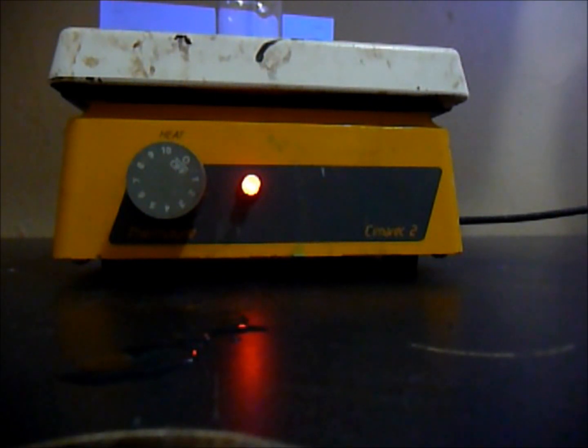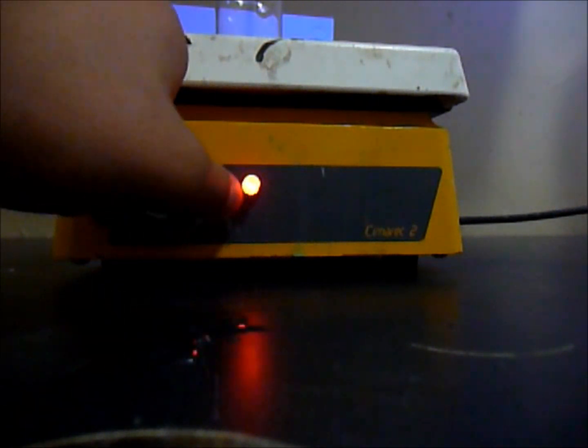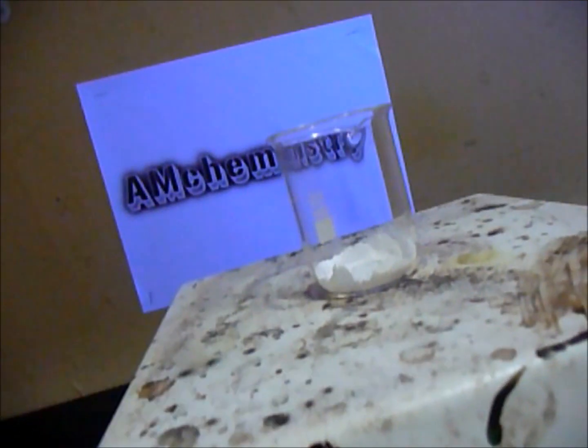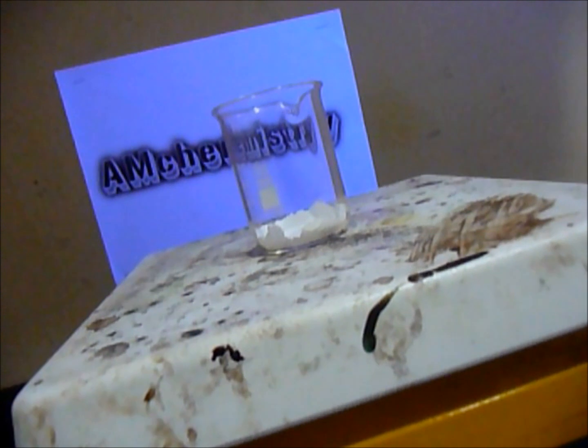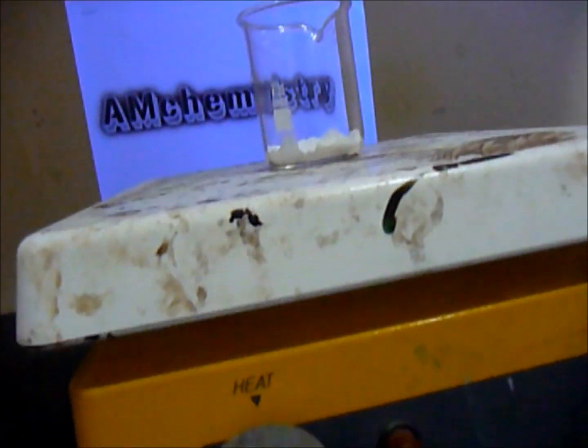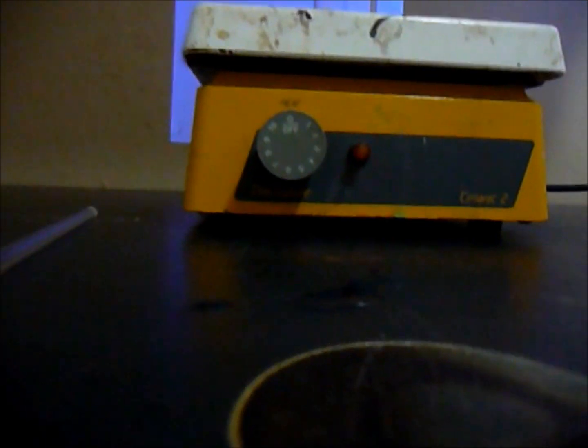So you can now take it off. I'll show you when it stops getting hot. When it's colder, I'll put water in it and do the test again.